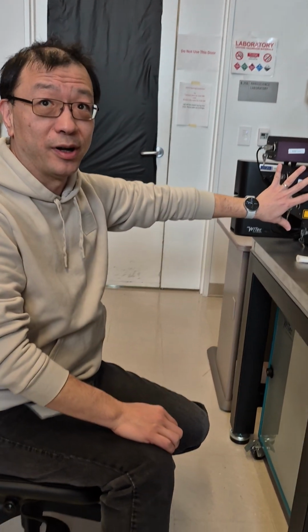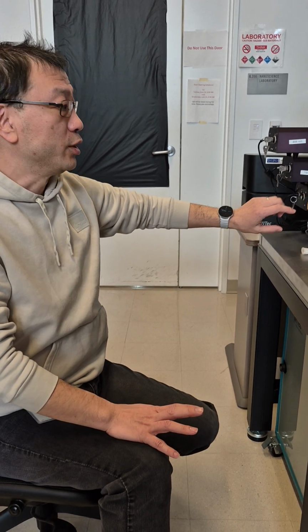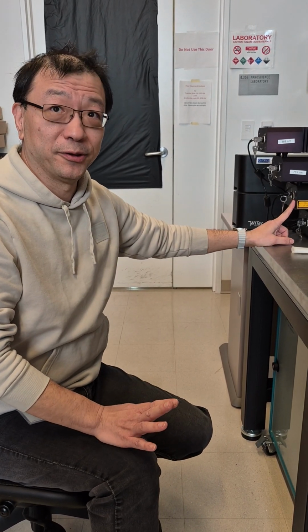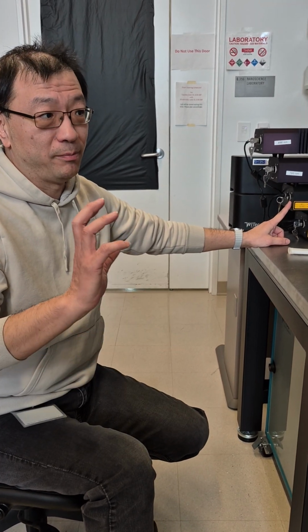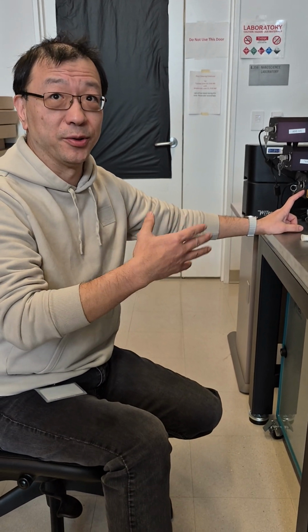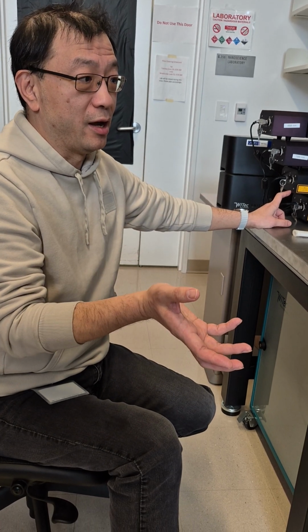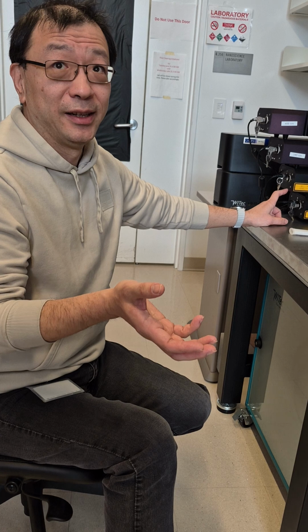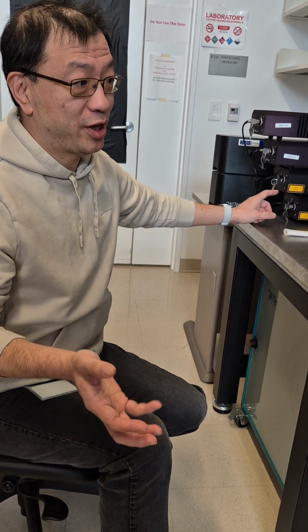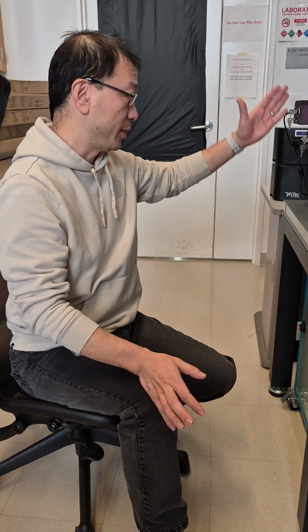This is the most important part because the laser is consumable in this case. If you leave the laser on after you use it, your charge will be based on the laser on time, not the time you use the microscope. If you forget, the next day we may check, we may not check. But if we didn't check and you let it run for 48 hours, your advisor will be charged for 48 hours. So before you leave, just make sure the lasers are off.